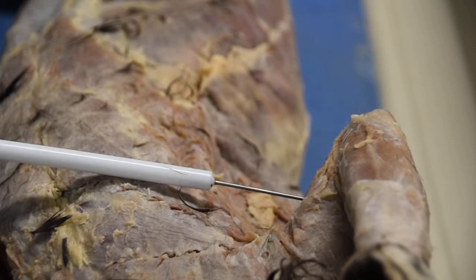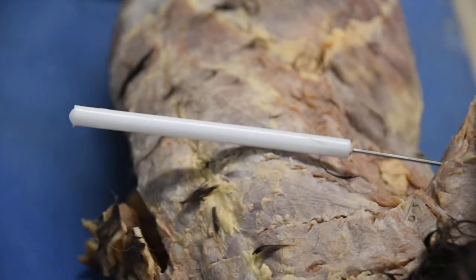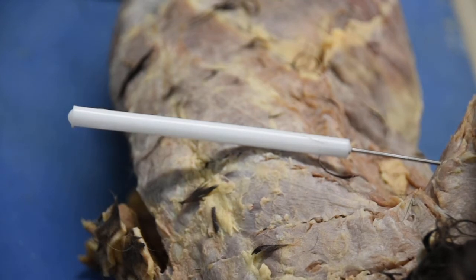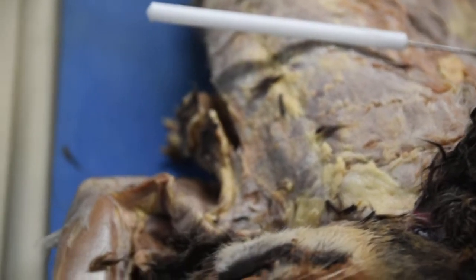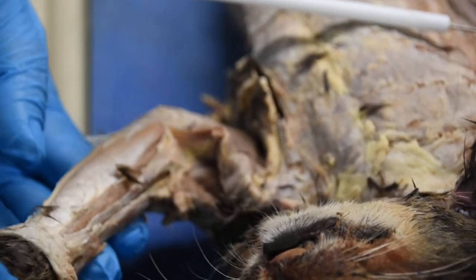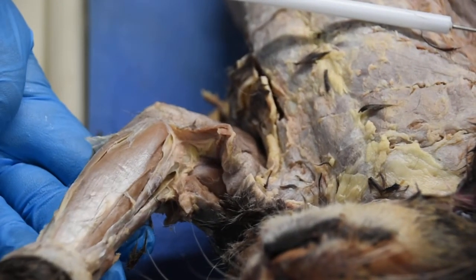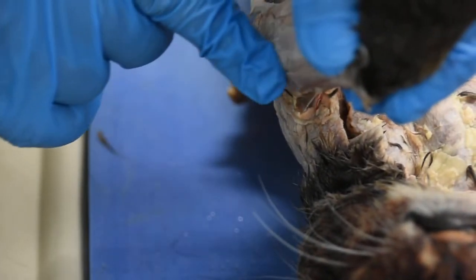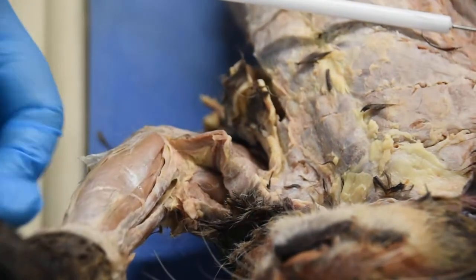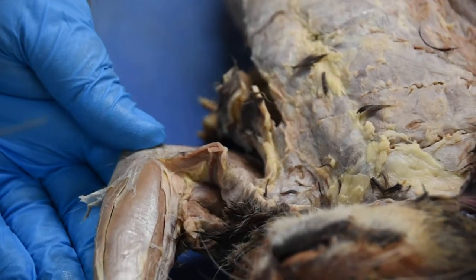Now moving on to the forearm. The forearm has muscles very similar to what we have seen in terms of your cat, in terms of your human. If we look at the muscles located on this side, these are also called flexors. And the muscles you will be finding on this side would be your extensors. So first, let's go ahead and get started with our flexors.